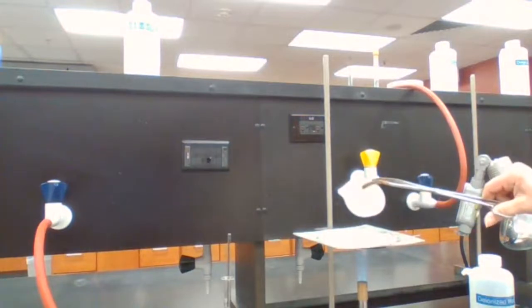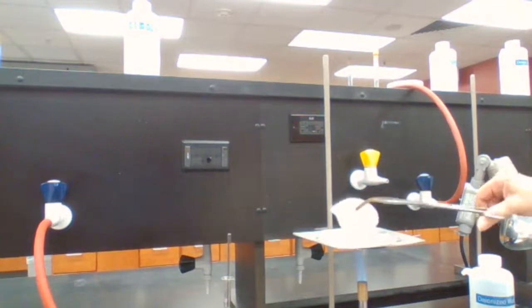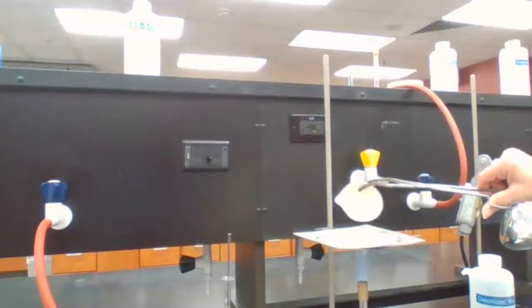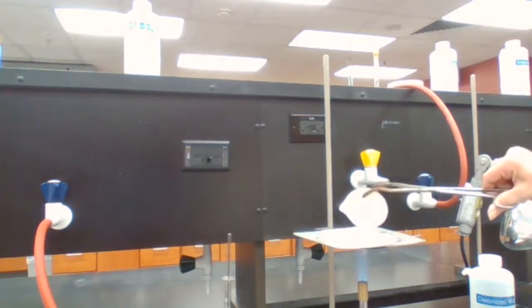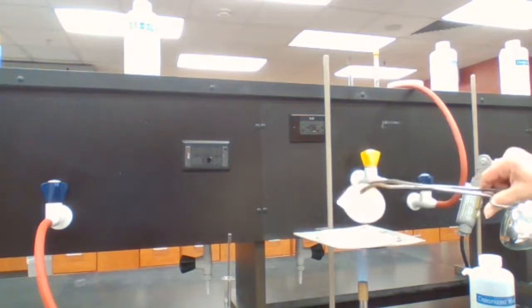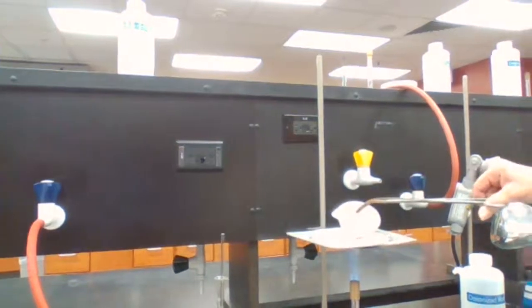It's dry. If I continue heating, I'm going to lose the powder. So I'm going to stop and lift it up for much more gentle heating. You don't want the color to change. The color should stay white as it is. But you want to make sure all the water has been evaporated.